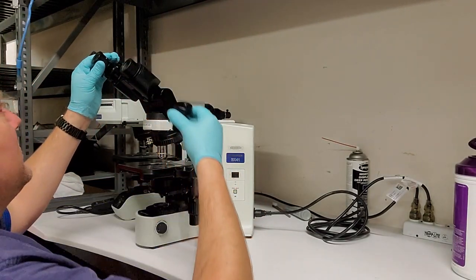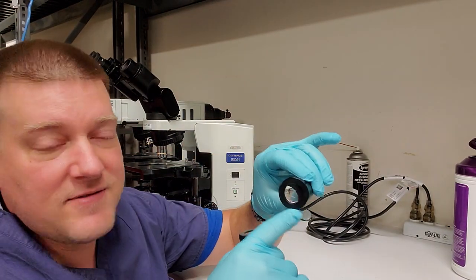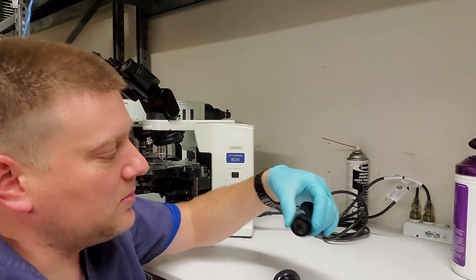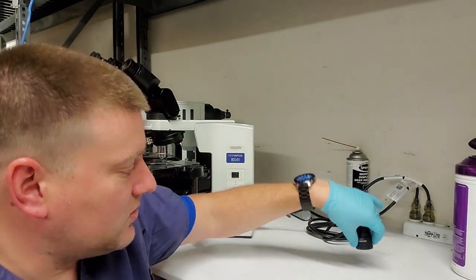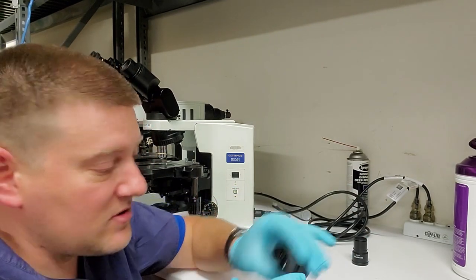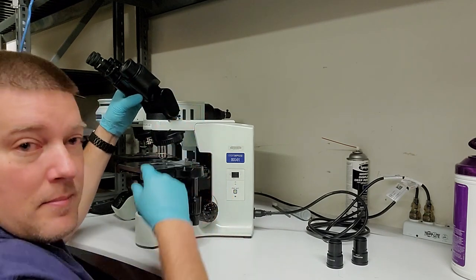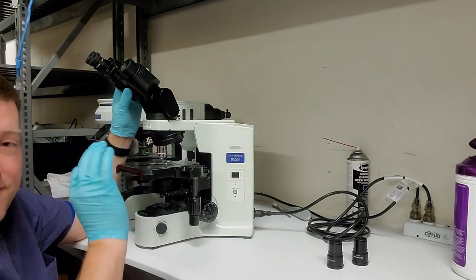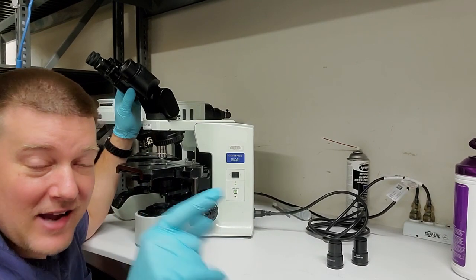So, one of the first things that I'm going to do is I'm going to take my oculars off. Now, these ones don't have the eye ring. These ones here are just a solid piece, and the glass is recessed from the surface. So, it's okay since my table surface is nice and clean to place those down. And my binocular is affixed. And I'm not going to shove nothing down the binocular. Don't shove nothing down the binocular.